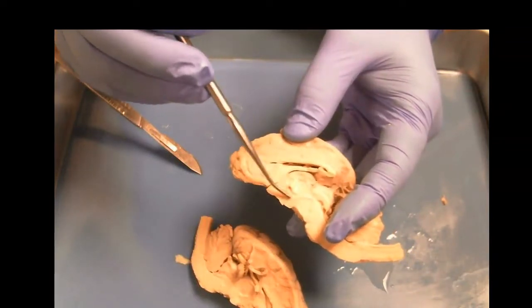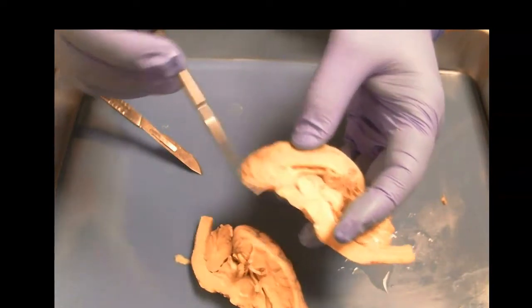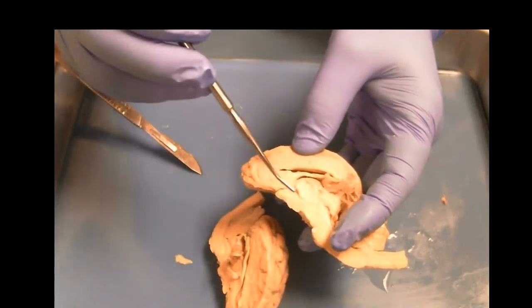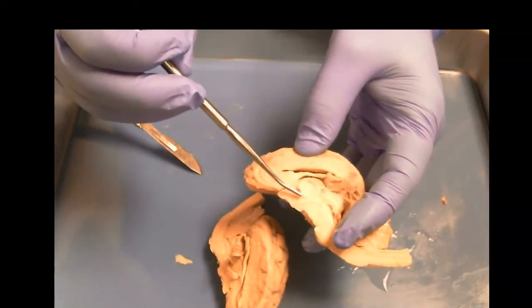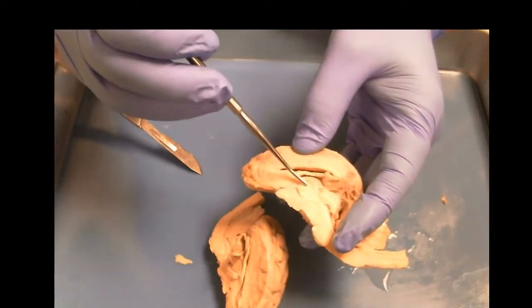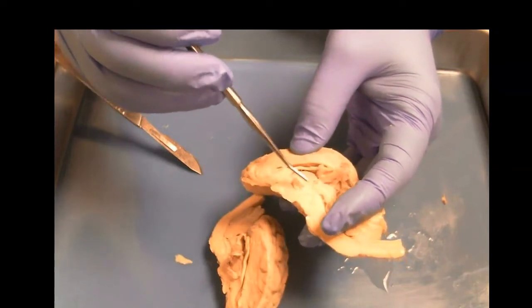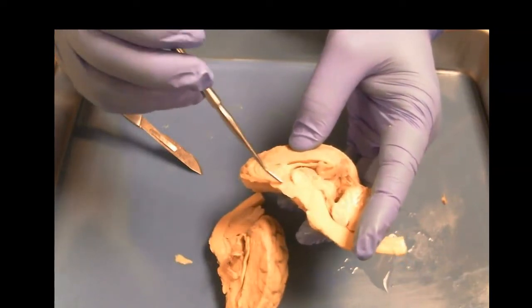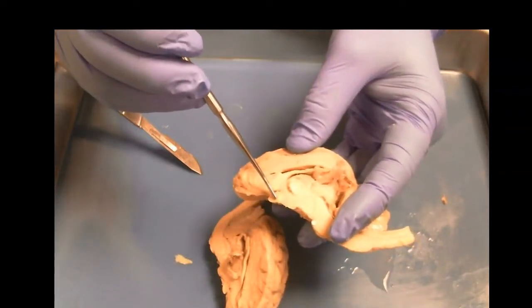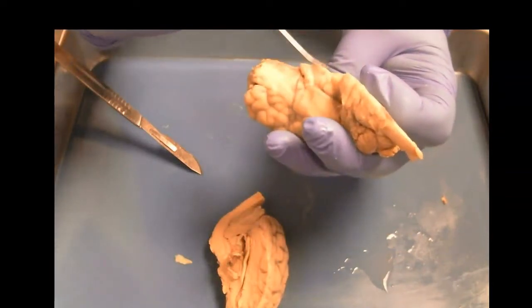This is the thalamus. It kind of holds it all together, right? Sometimes there's a little adhesion here, which appears to connect the two halves of the thalamus, but the interthalamic adhesion doesn't actually connect them. The connections go and then turn around and come back. So each thalamus is separate, but there are commissures connecting them. Here we see this bump, cranial nerve 2, the optic chiasm, and the mammillary body down here.